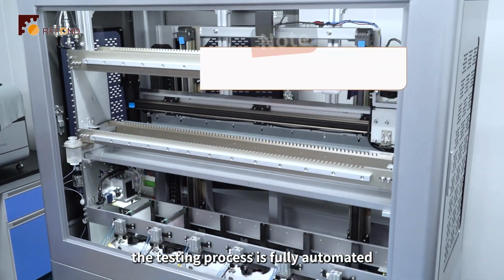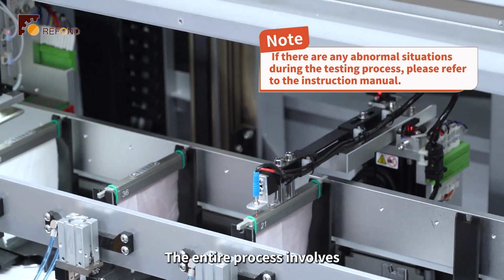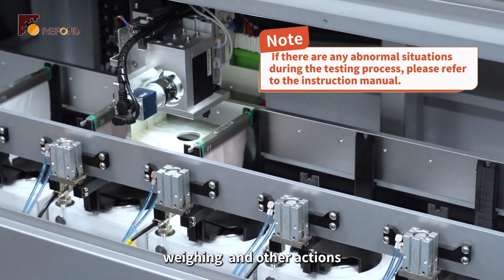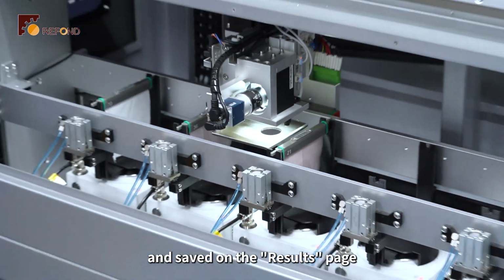After starting, the testing process is fully automated and does not require manual intervention. The entire process involves automatic execution, transportation, hanging, dripping, weighing, and other actions. Finally, the test results are calculated and saved on the results page.